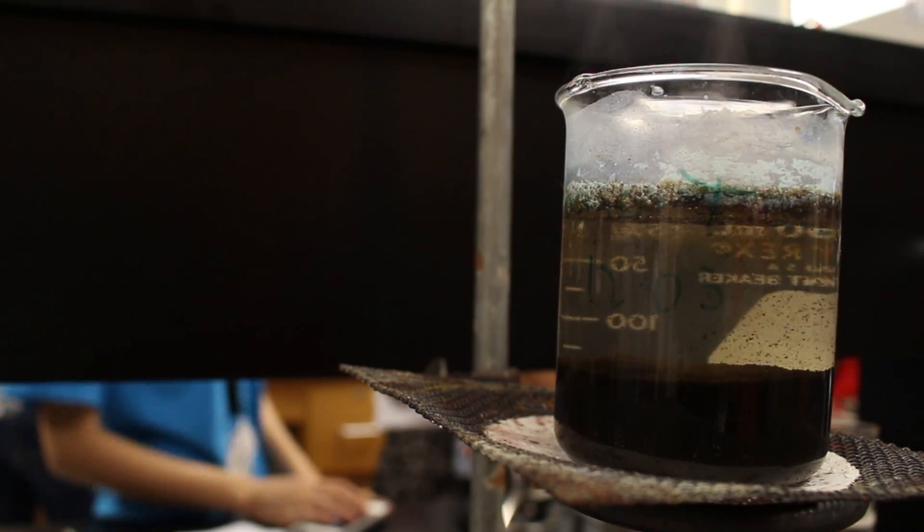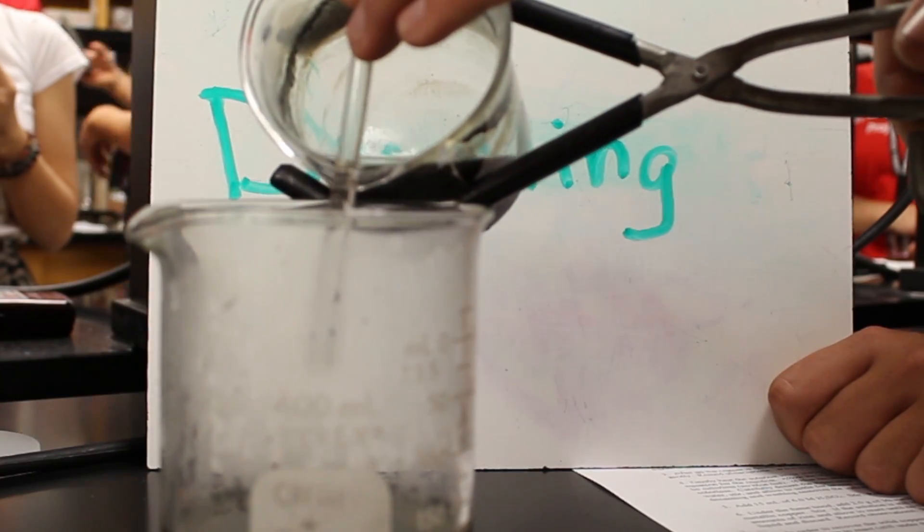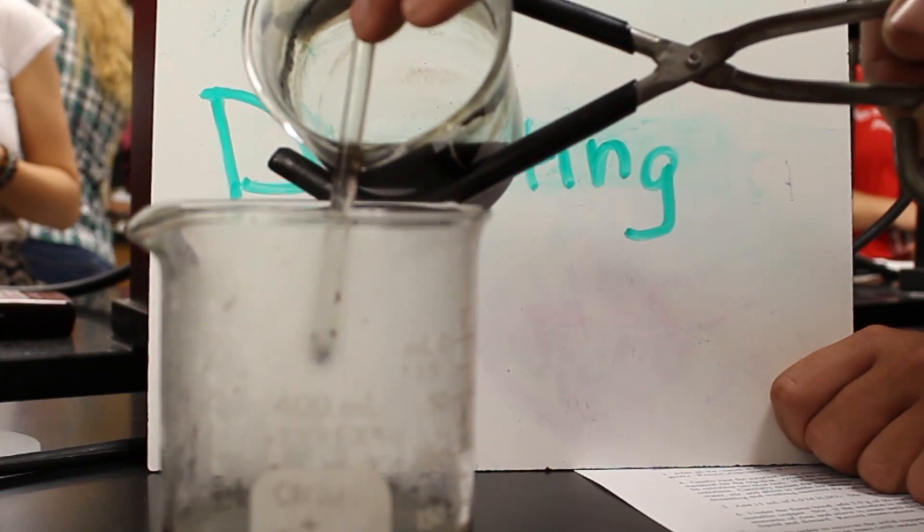We allowed the copper oxide to settle out and decanted the excess liquid several times in order to remove all aqueous sodium nitrate.